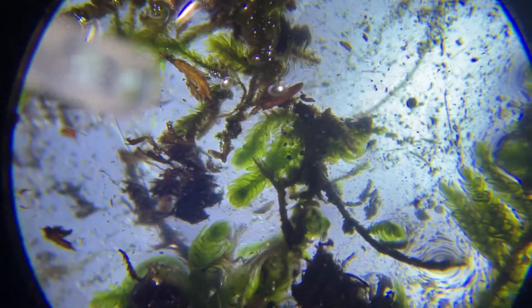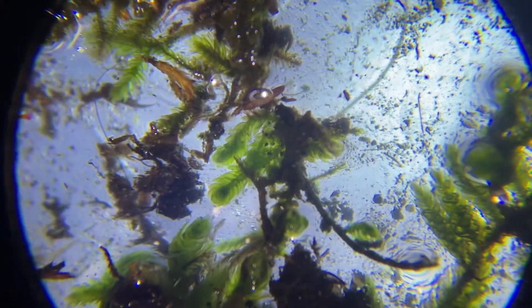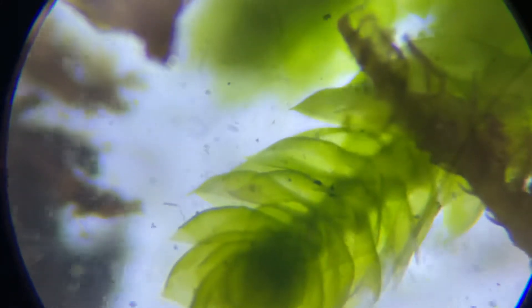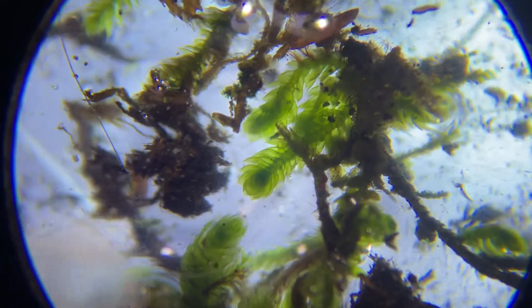Really what you're looking for is motion. Once I see motion I can zoom in like this. At this magnification level you would surely see the tardigrade — just like it was under a regular microscope. This is a stereo microscope, lower power, and it zooms back and forth.